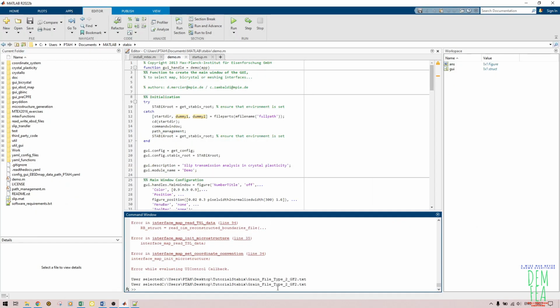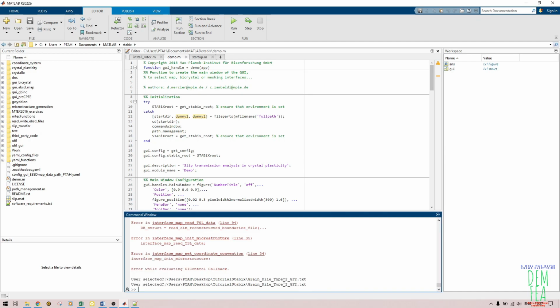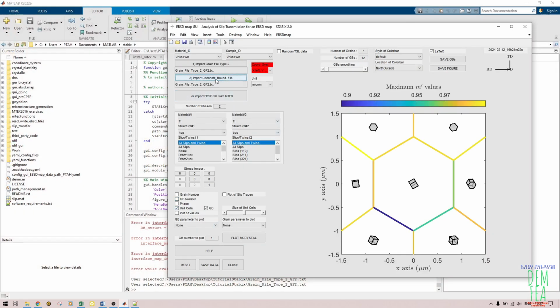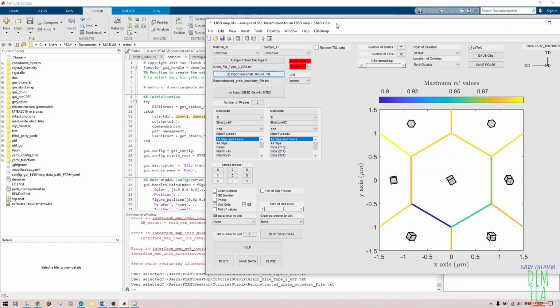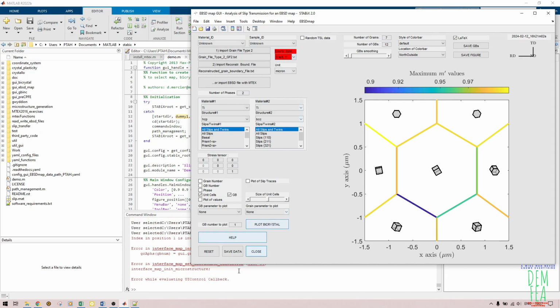So as you can see, this is what we have selected, but that means I have selected the wrong file here. As you can see, I've selected grain file type 2 times. So, reconstructed grain boundary file like that, yeah, like that. So as you can see, if you want to check what you have imported, you should always take a look at this window. Now after that, come here, and now we do that.